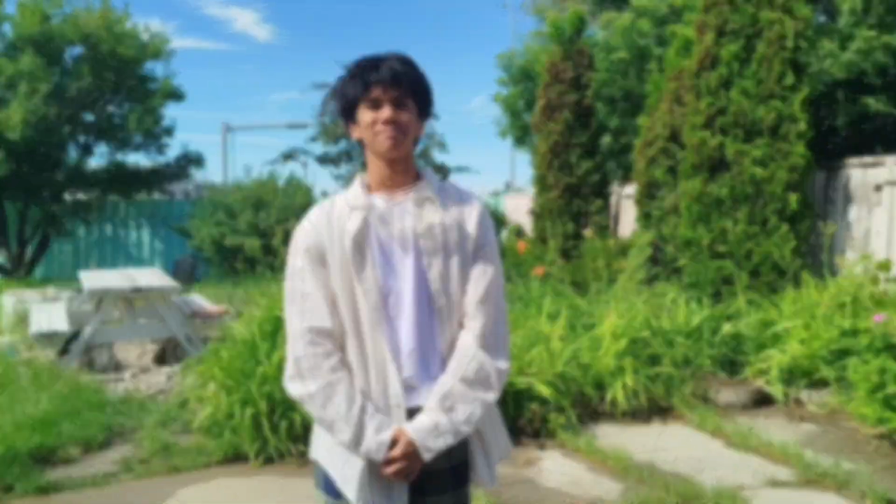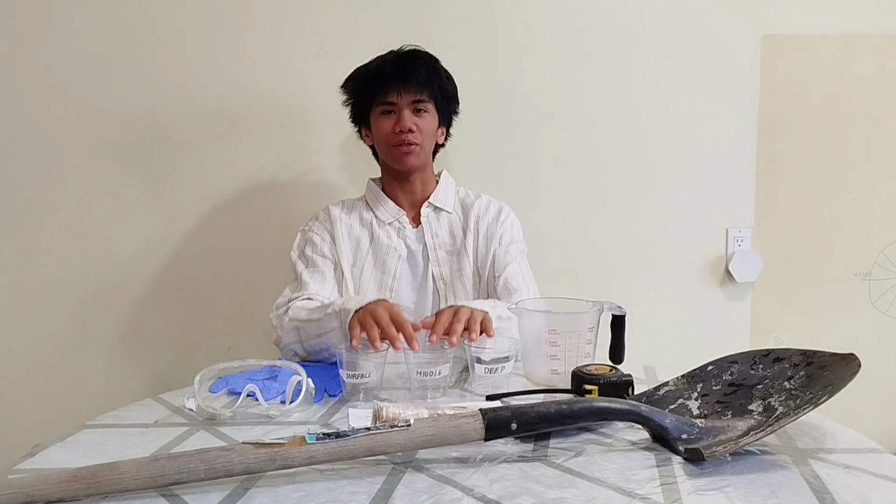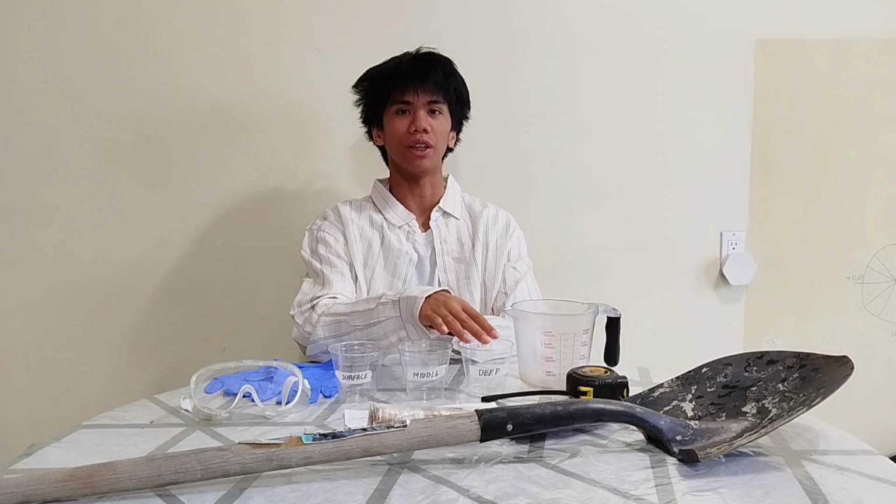Welcome to my video presentation for Unit B, determining the alkalinity or acidity of soil. Let's start with our equipment. Here we have 3 plastic cups, each representing a different depth of soil.